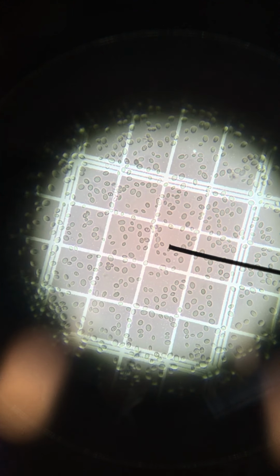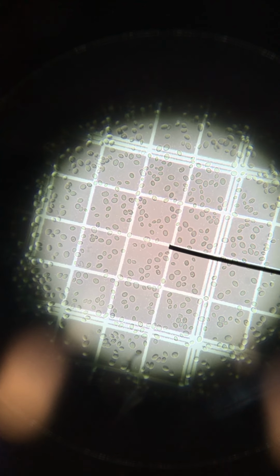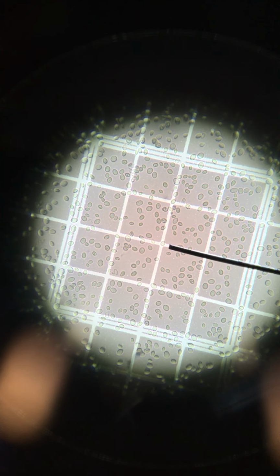So go ahead and reposition your view so that your upper left corner square is centered, and you're going to increase magnification one more time to the 40x objective lens. And as you refocus, you will see this square. You will know that you are on the correct square because you'll notice that the outer boundaries have 3 lines on them. And so that is the appropriate magnification.